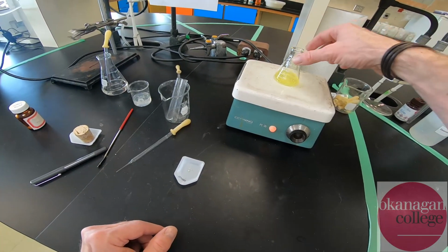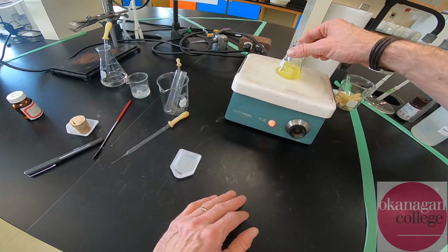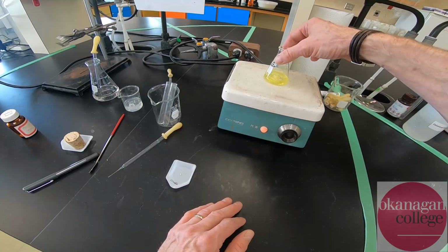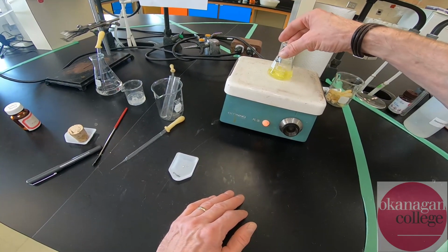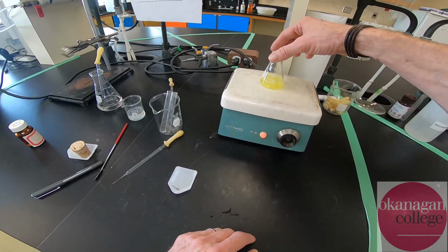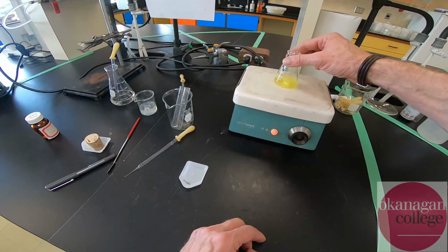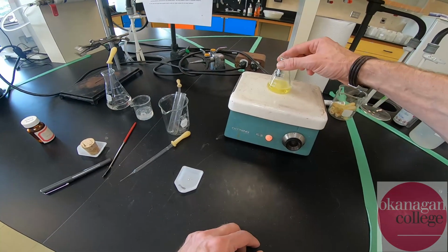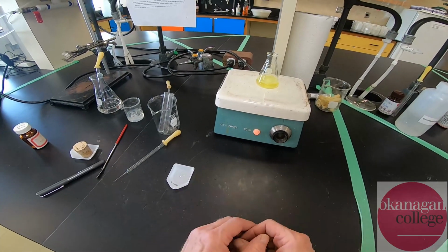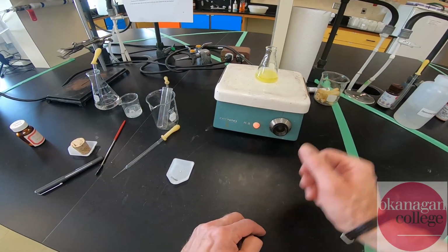Okay. Now this is just an approximation, right? I'm using the marks on the Erlenmeyer flask, which are notoriously inaccurate, but it's going to be ballpark-ish. So in my notebook, I'll write down approximately 15 mils initially, followed by an additional 6 mils in the dissolution of the material. Now, we can't be too specific with this because we are losing material through evaporation, and recrystallization is always done sort of as a needed amount, right? You watch the process. If you have to add a little bit more, you add a little bit more. An exact volume measurement isn't actually that useful. It's just kind of doing it by eye. All right.